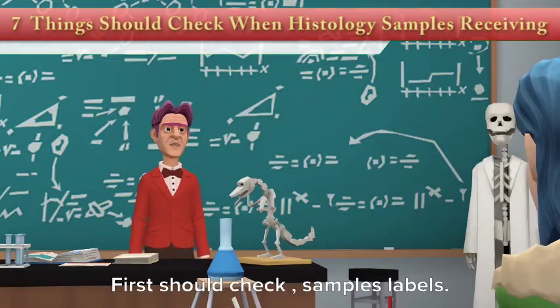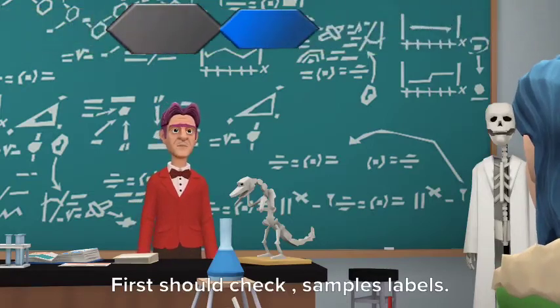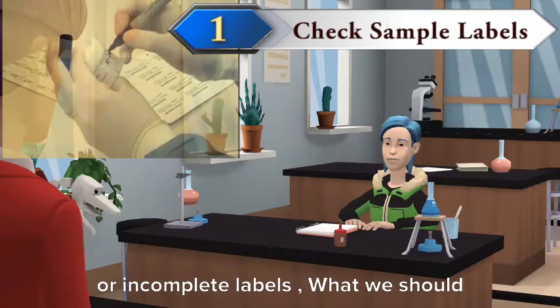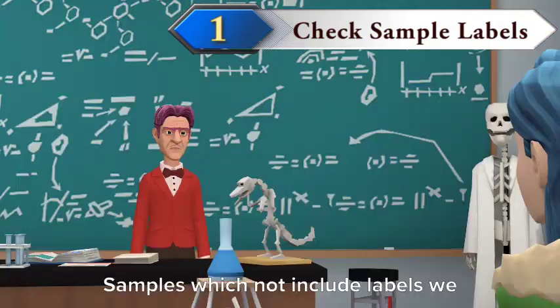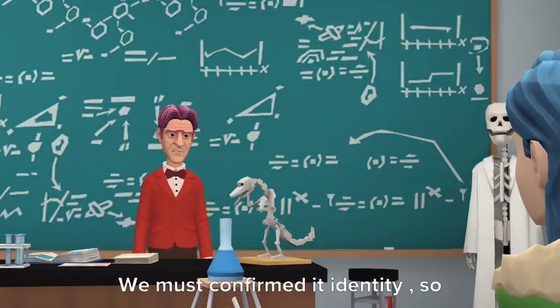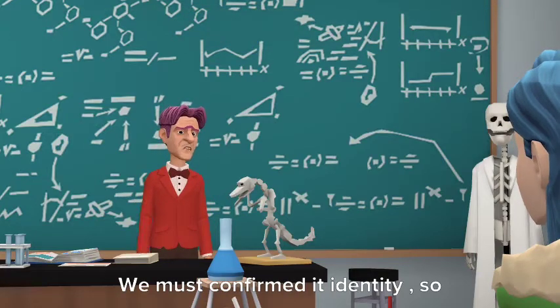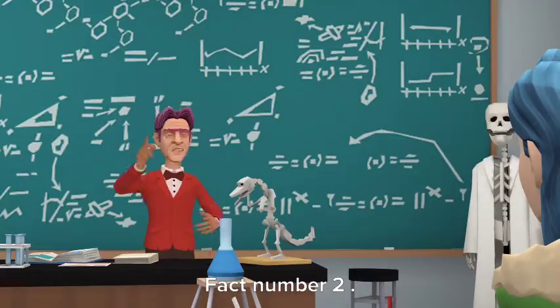First, we should check sample labels. If we receive samples which are not labeled or have incomplete labels, we cannot proceed. We must confirm the identity, so we have to return the samples.